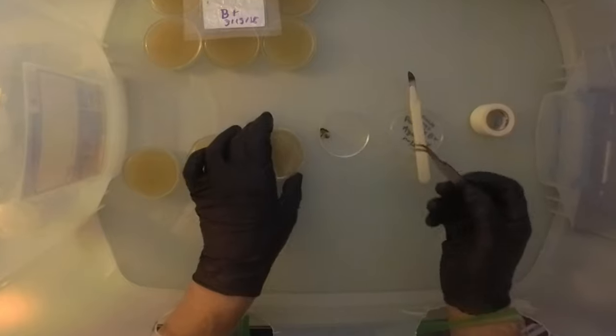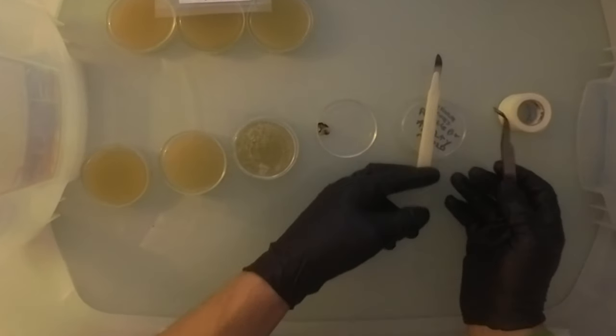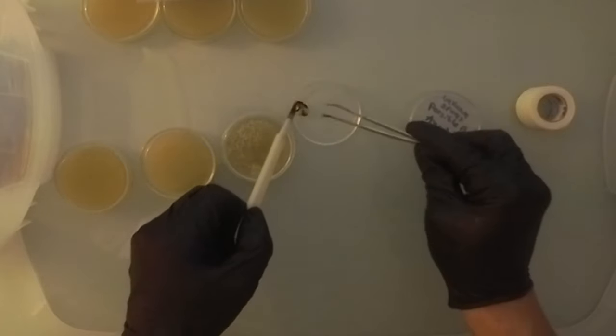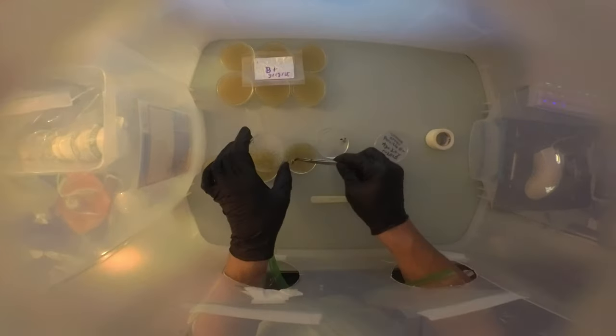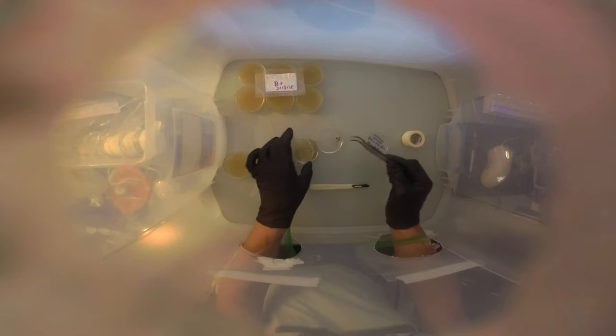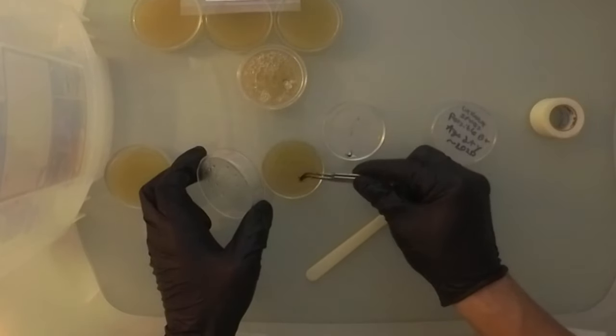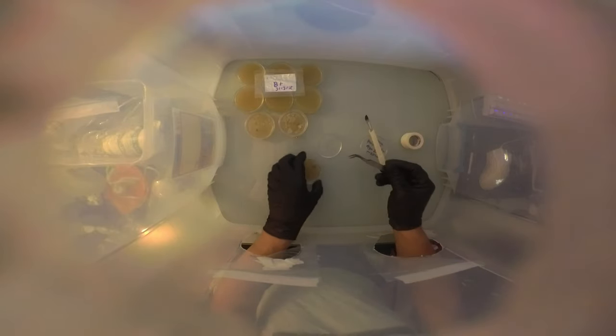Keep in mind that these mushrooms were dried at a very high temperature, so the spores inside of them may be inert. Also, as spores age they dry out and become inert. For all of these reasons and others, I don't have high hopes that these will germinate, although I think the experiment will be a fun study.